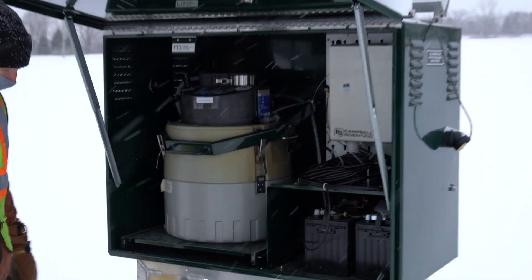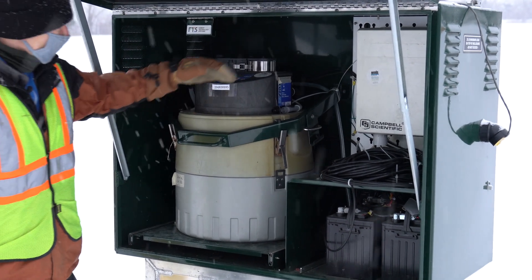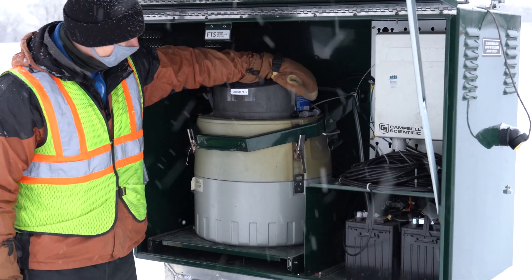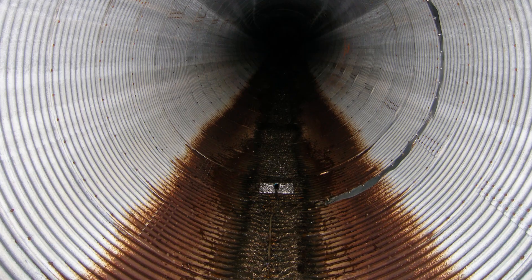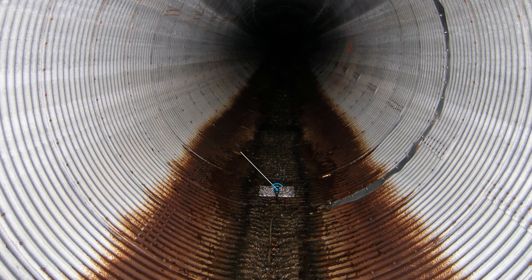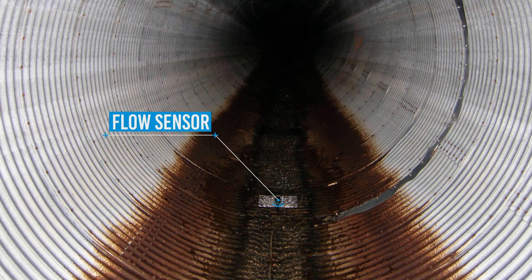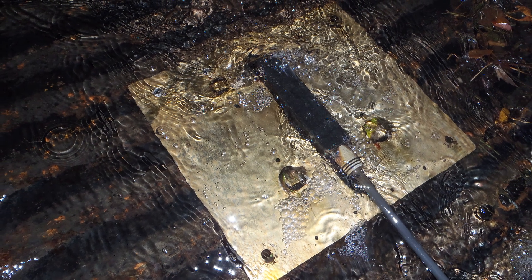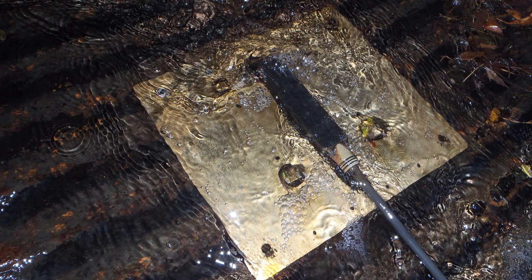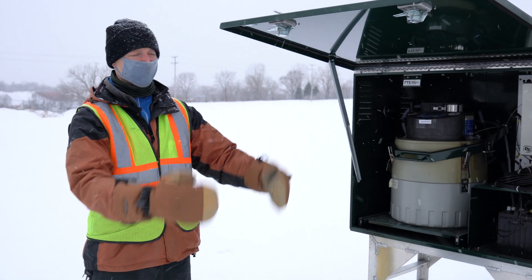To measure the water flow, we've got a cable connected to this sampler that goes into the tunnel, and that sensor measures the velocity of the water in the tunnel and also the level of the water. Then it calculates the flow so we know how much water is going into the river.